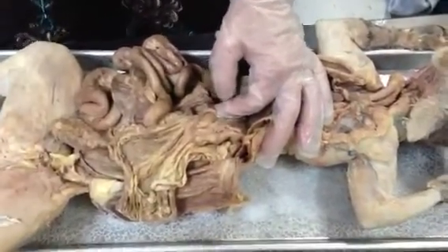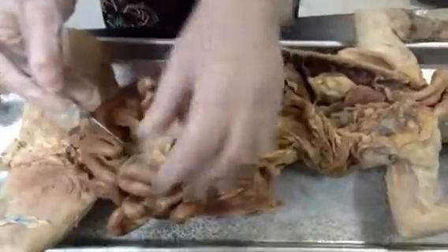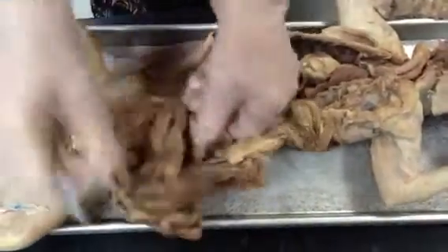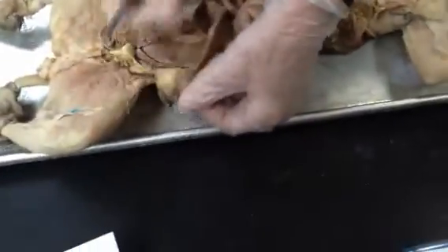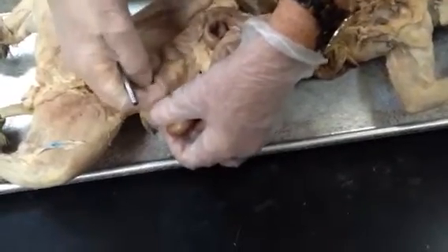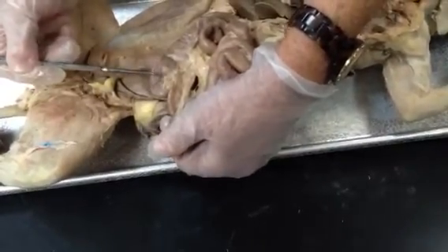All right, next thing was the ileum, which is the last section of the small intestine. So, here's your mesentery, real thin membrane. You can see the vessels in there. Following that around until we find, it's way turned around. Okay, small intestine, notice the diameter of the tube. Notice how it gets thicker. So this is your cecum. It's kind of like got a little bit of a curve, C for cecum. Again, you can see that dense connective tissue, fatty stuff on the outside too. Okay, so ileum, cecum. Okay.